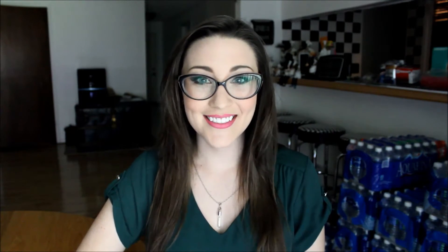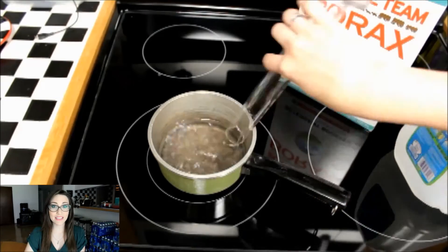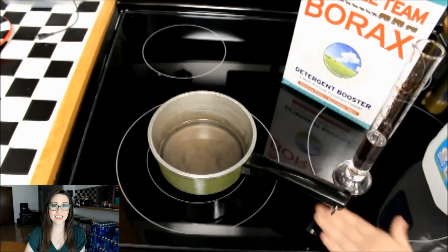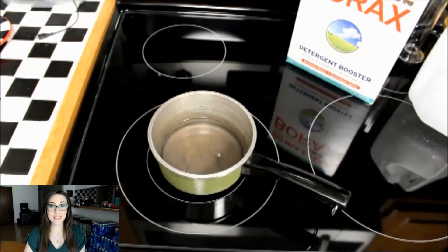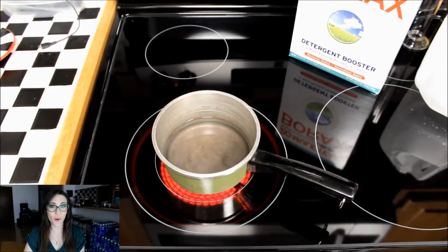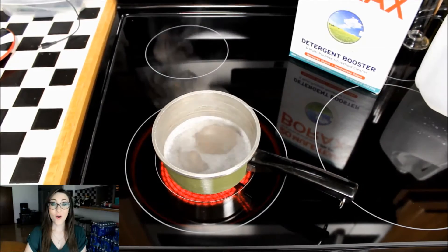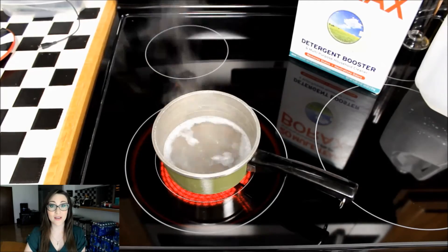For this step, you're going to need a small pan. Measure out and add 250 milliliters of distilled water, then turn the heat on high. You'll need this much saturated sodium borate solution to prepare your trypsin solution, but it's easier to measure out what you need from a larger quantity. Wait for the water to get to a rolling boil, then put the heat on low or simmer.